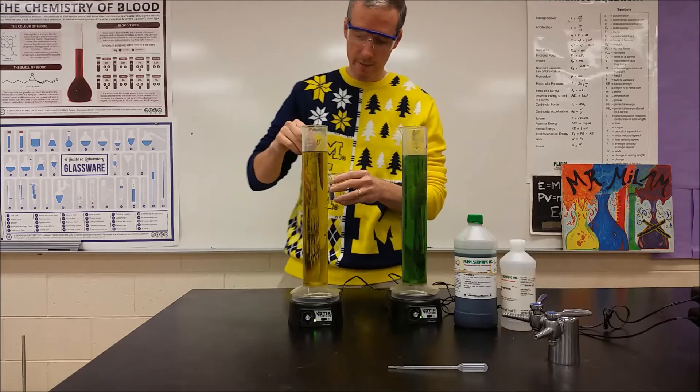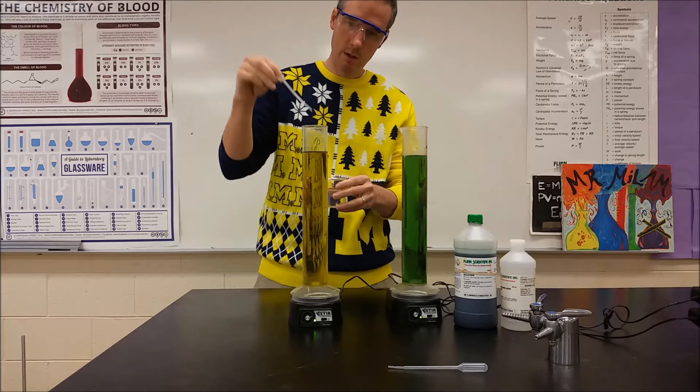And then we're going to go over here. We're going to add a milliliter of hydrochloric acid to the distilled water.